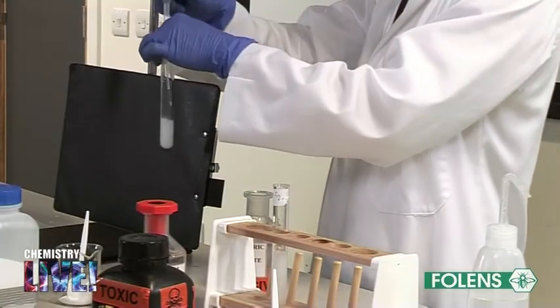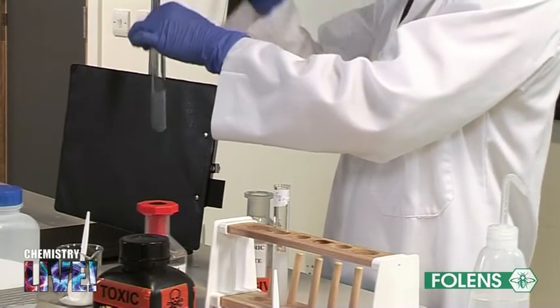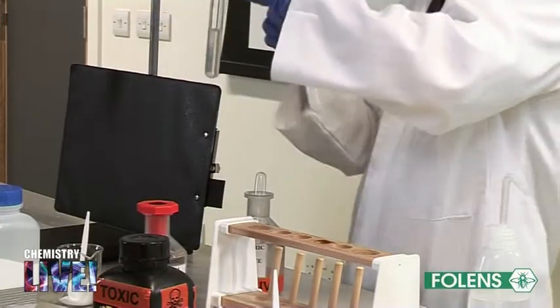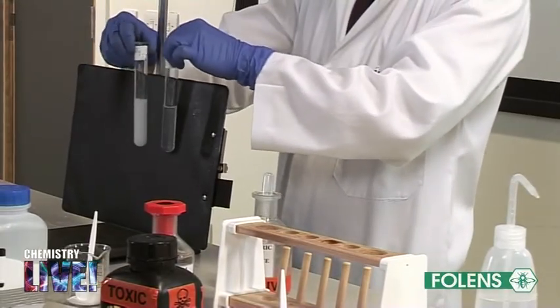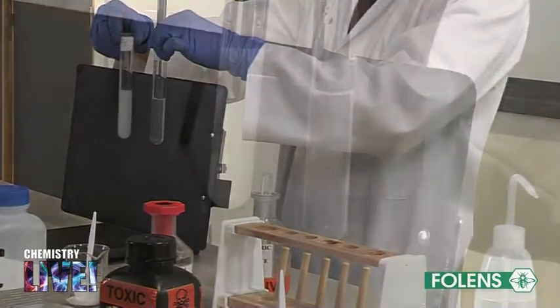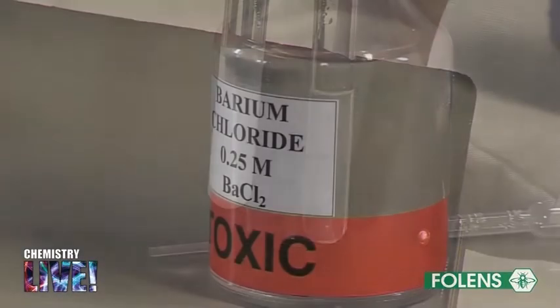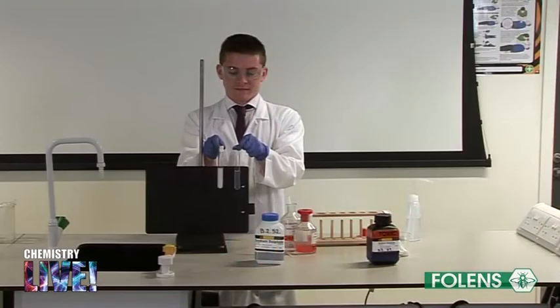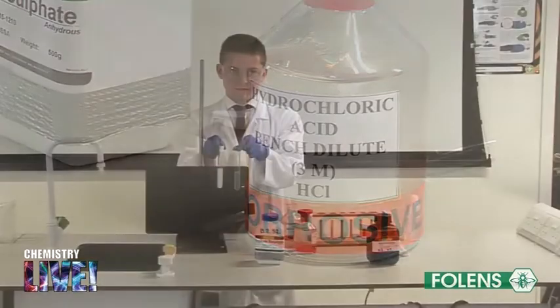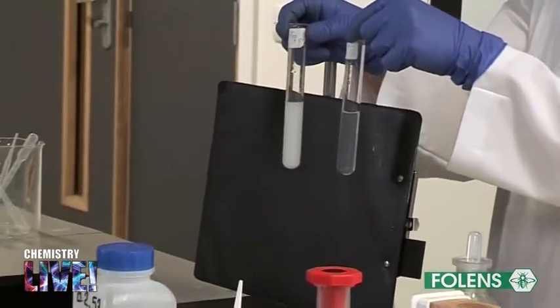However, barium sulfite dissolves in dilute hydrochloric acid. Thus, the cloudiness disappears in the case of the sulfite ion and remains in the case of the sulfate ion. In conclusion, sulfate and sulfite ions are detected using barium chloride solution. They are distinguished from each other using dilute hydrochloric acid solution. Barium sulfate is insoluble in dilute hydrochloric acid, but barium sulfite is soluble.